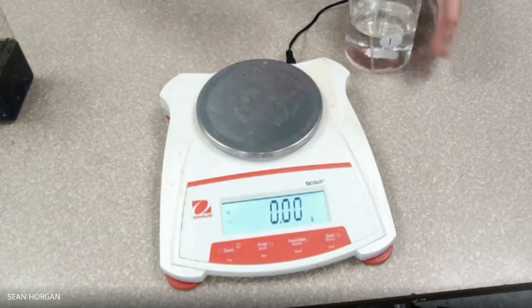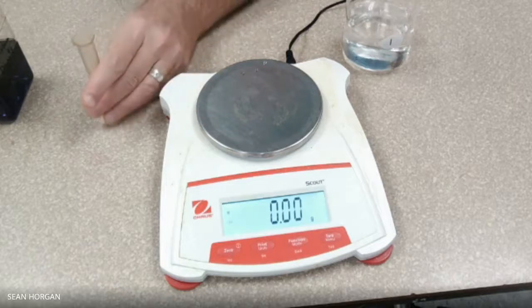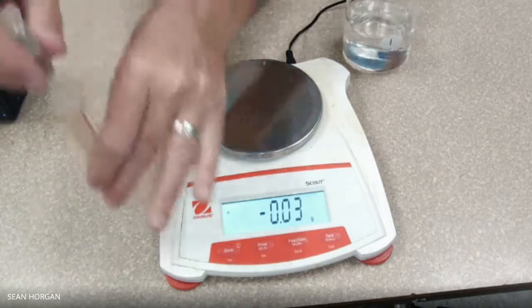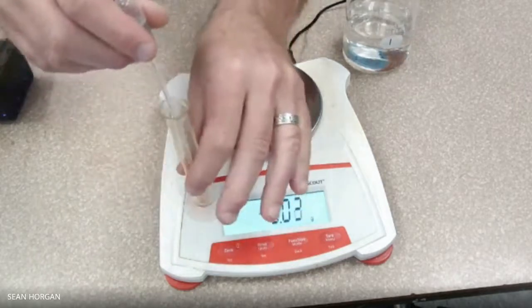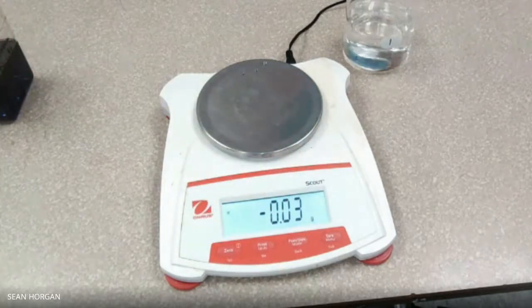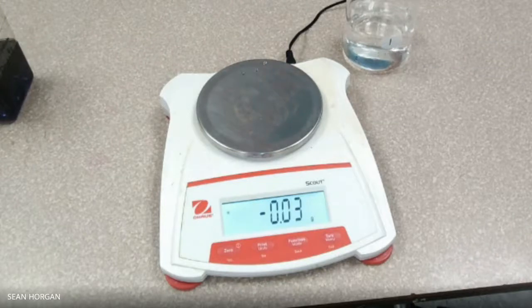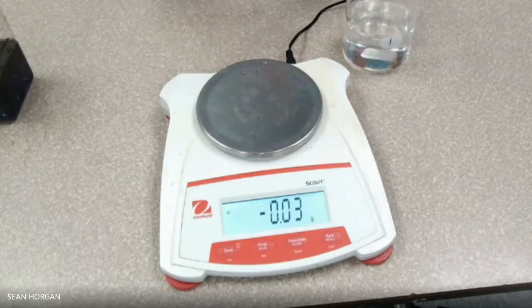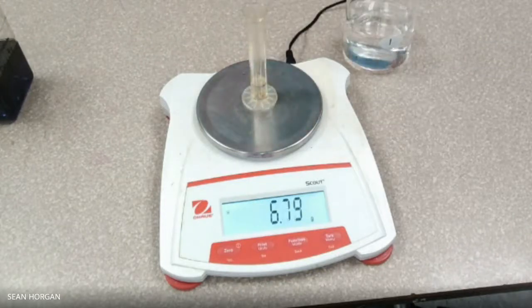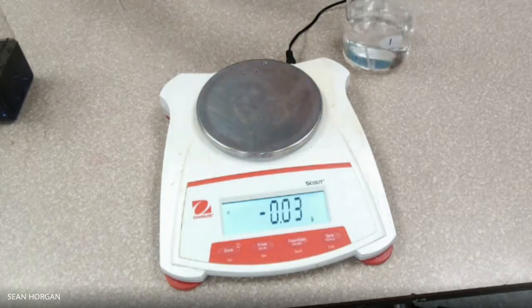So then we're going to go ahead and use our pipette and add water to it. We're going to add exactly two milliliters, and then we're going to put it on our balance and it's going to give us a reading. So that's the reading for two milliliters with the graduated cylinder.